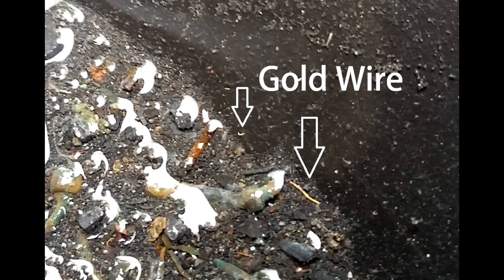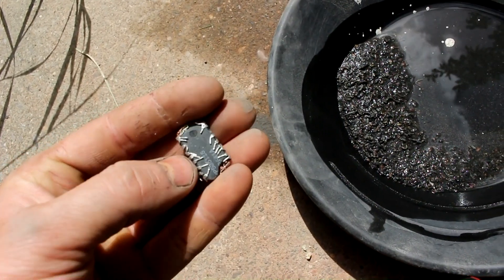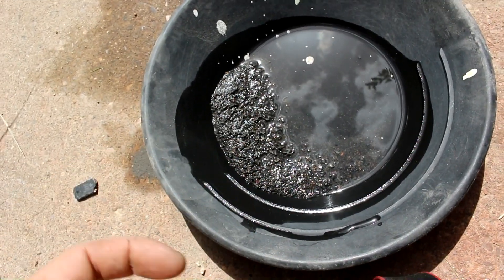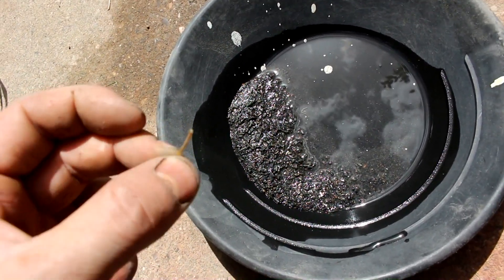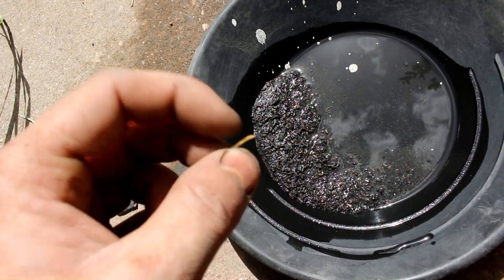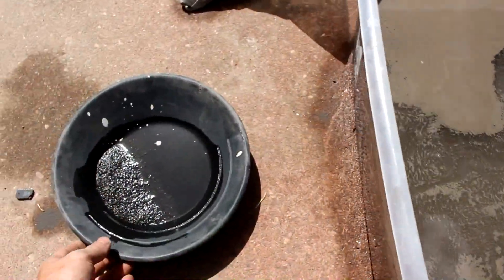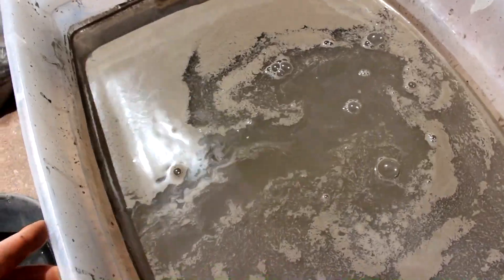I can see some pieces of solder and mostly little copper pieces of wire, but I have seen some tiny gold wires — those actually came out of integrated circuit chips. They use a very fine gold wire to connect between the thick external leads and the actual silicon chip inside. I've also seen some very fine gold powder, which I suspect came off the gold pins where the plating flaked off as the base metal melted or oxidized. Some gold may have washed off, which is why I'm collecting the wash water — if I find significantly less gold than expected, I'll rework this using a cyanide bath.